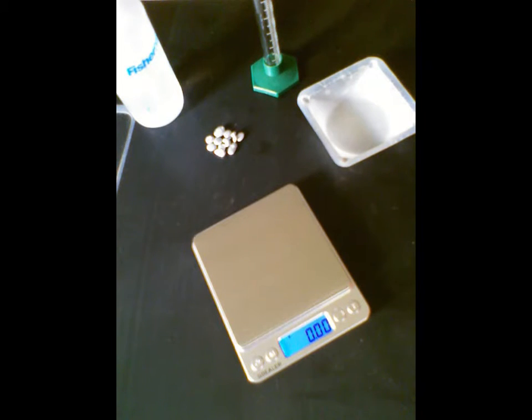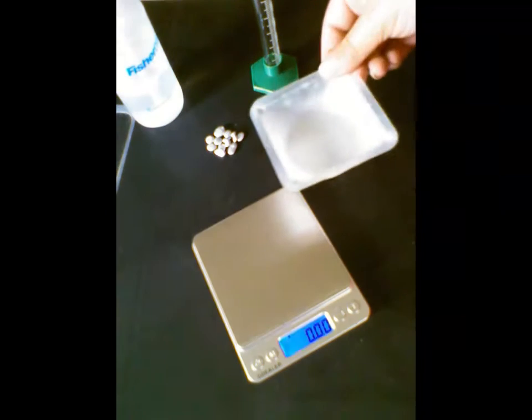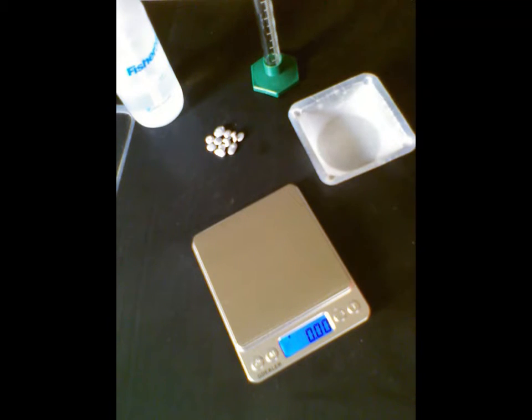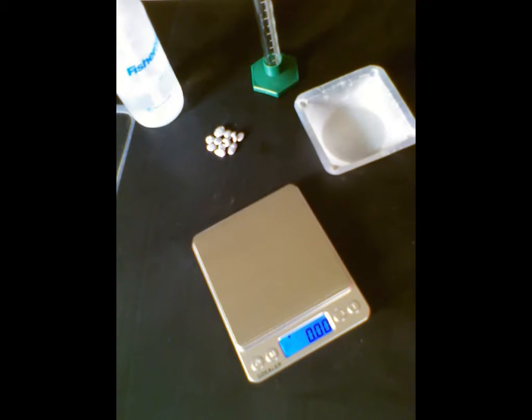do things in chemistry, so that we don't ruin our scales, we use what we call a weigh boat. That's this thing right here. It protects the scale if something that we're weighing is round or is something that might stick to the scale or damage it in any way. We can put it in the weigh boat, and then we're able to use the weigh boat to transfer that to wherever we need to later. When we get to more technical things that require us to use powdery chemicals, that's definitely going to be important. So we're going to start using it right now.